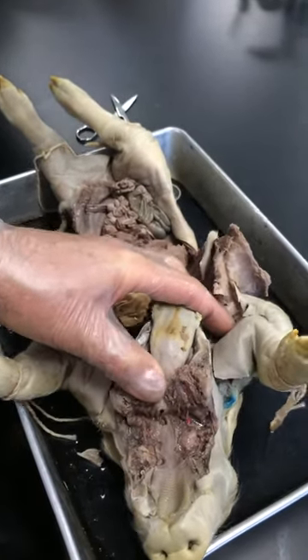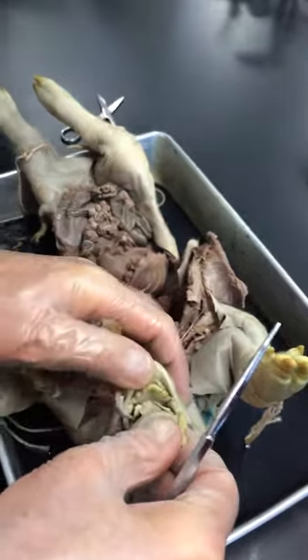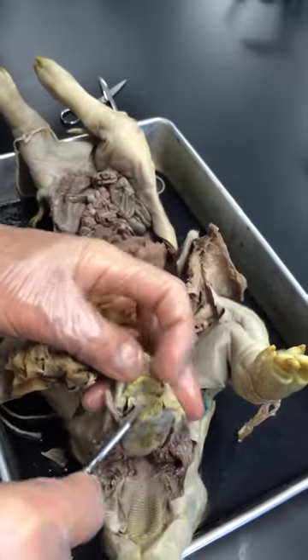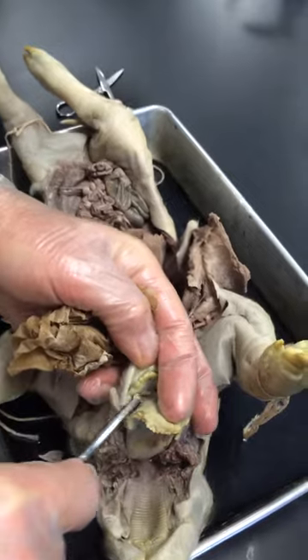Lingual frenulum is the membrane that anchors the tongue to the floor of the mouth. You can see it right there.